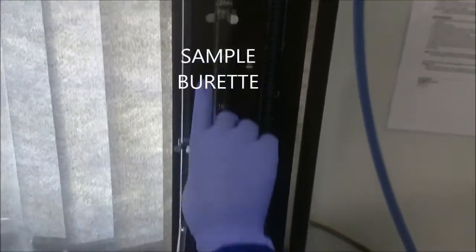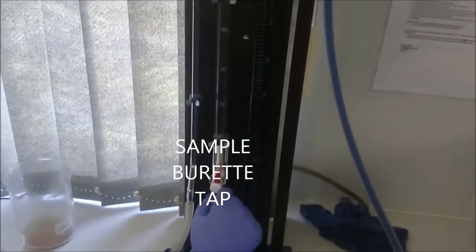So now this is the sample burette, and the tap must be open.